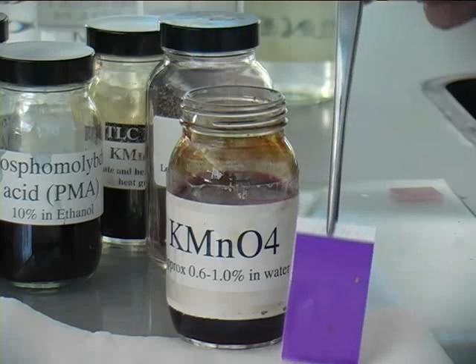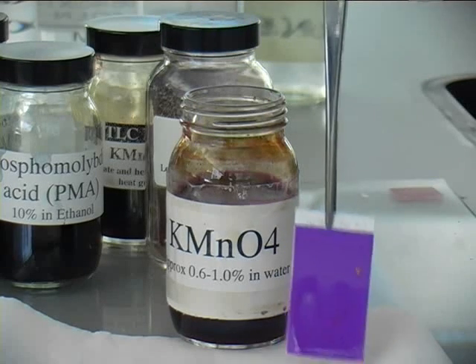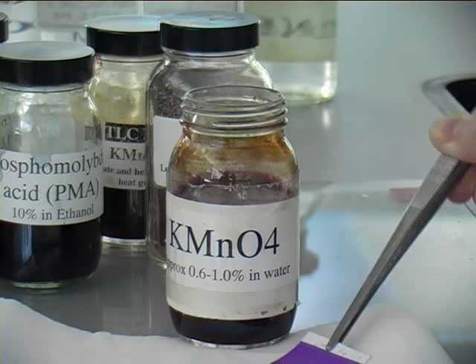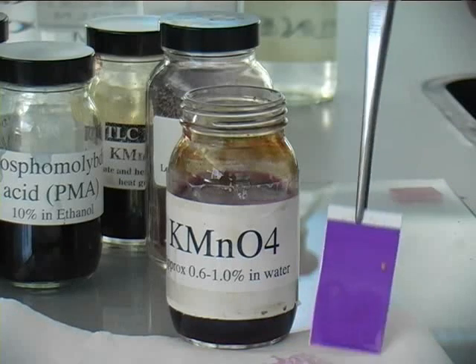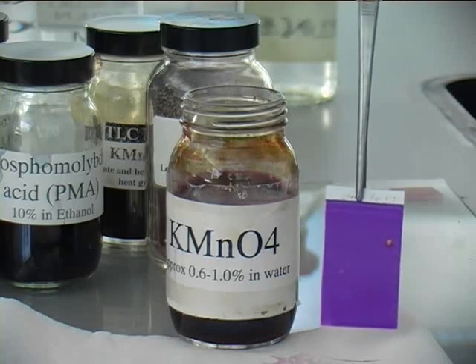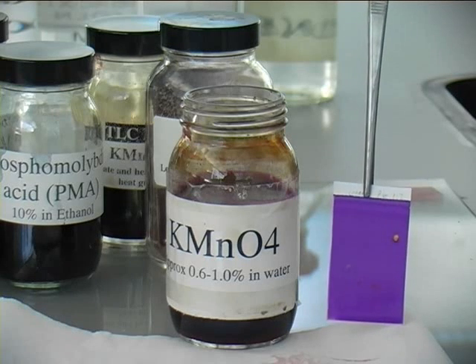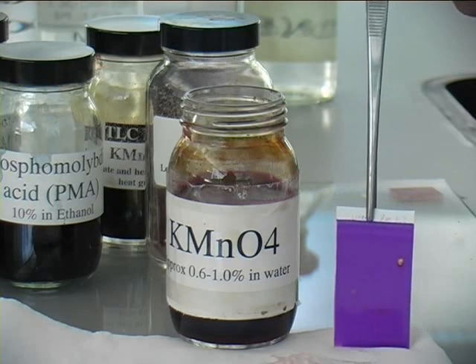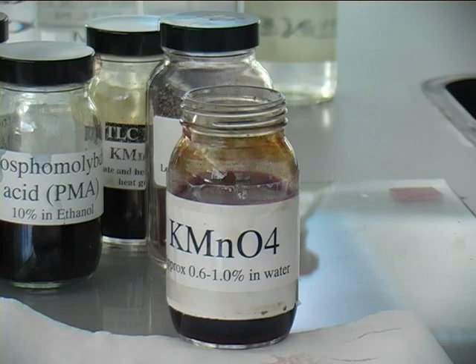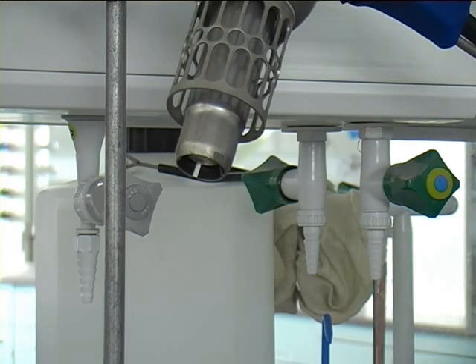As you can see here, sometimes already at room temperature, you can see a color developing. Try to get rid of excess permanganate solution, and then use a heat gun to heat the whole TLC plate up, which helps visualizing more spots.